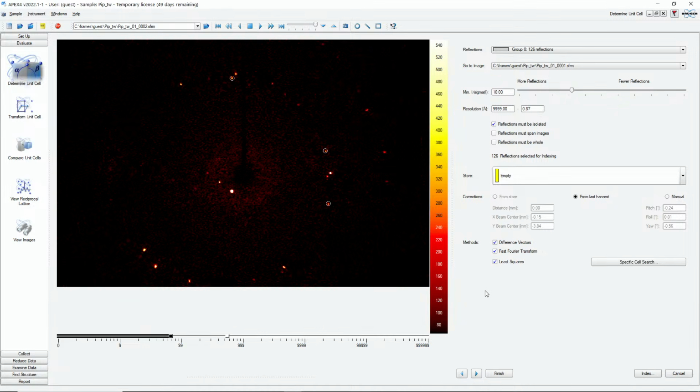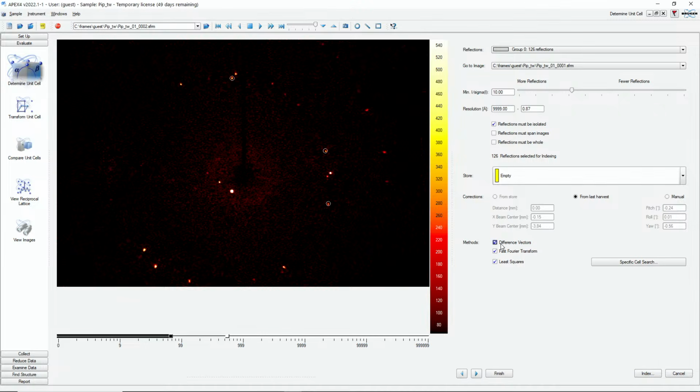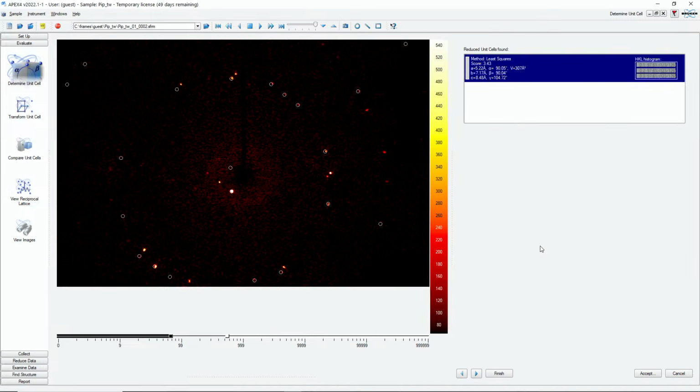Okay. And what we can do here is a specific unit cell search. Typically, we search between maybe 3 angstroms and 45 if you use this method. But we had seen that there is not a really long unit cell axis in this case. So if we just reduce this to maybe 12, and we can measure in reciprocal space, we can measure distances and use this for indexing. And if we turn off maybe the first two, then this might actually also fall out automatically. Okay, so you just basically put some boundaries on it, and then it can do it automatically.